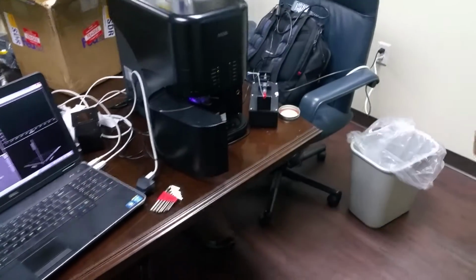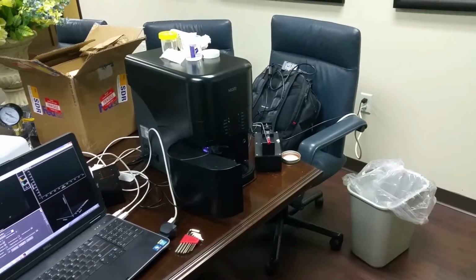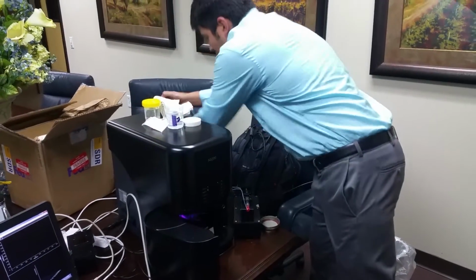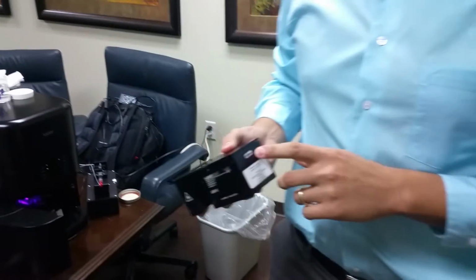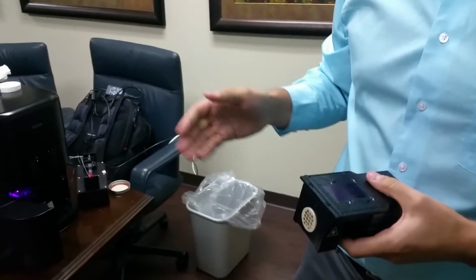So we've gone through the different laser colors and explained the different laser colors related to the energetic effect on the nanobubbles that you've seen. We've brought today 3 different modules here, and each one contains their own laser. So we've got a 488 laser source, a 405 laser source, and a 532 laser source. We understand that the shortest wavelength is the most energetic, and we found that there's a size dependence and image dependence on the laser wavelength of choice on both count and the total particle size distribution.